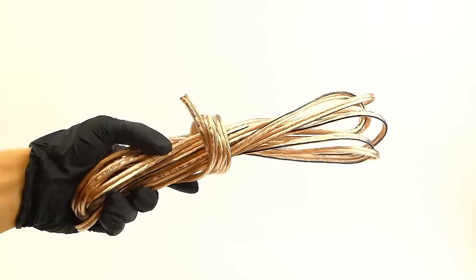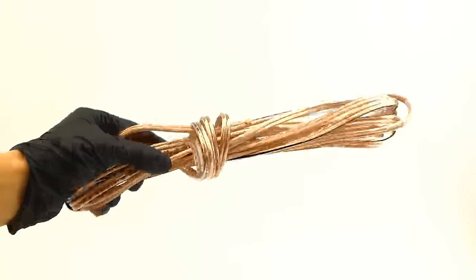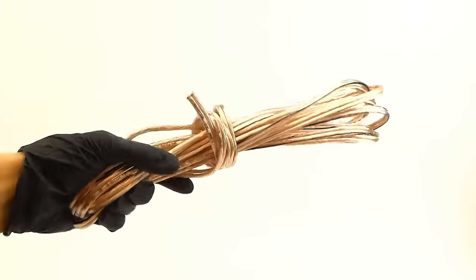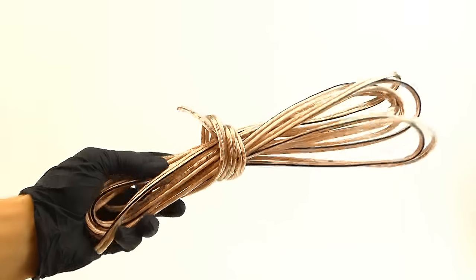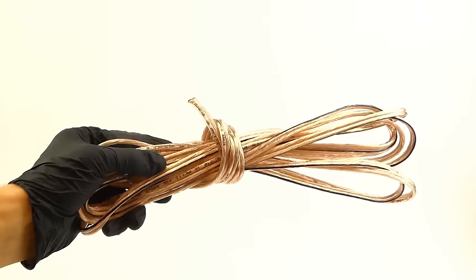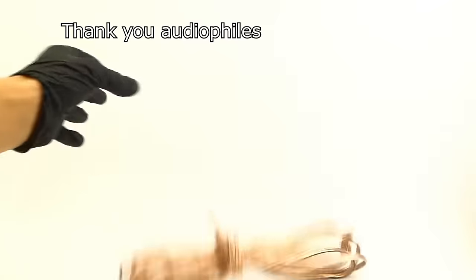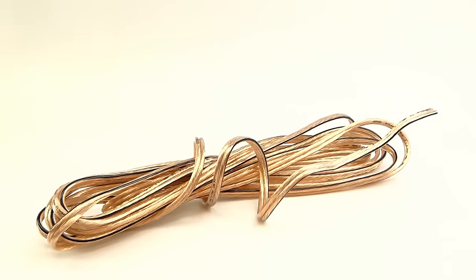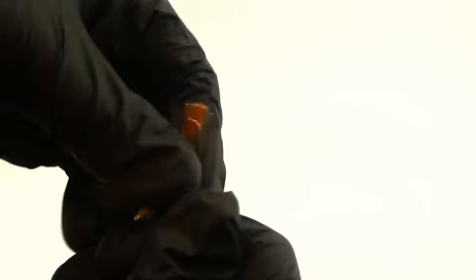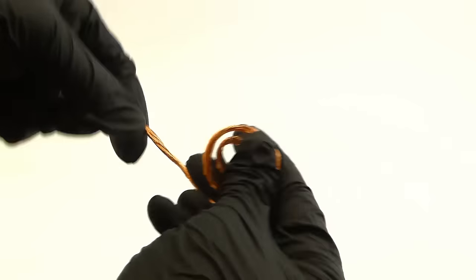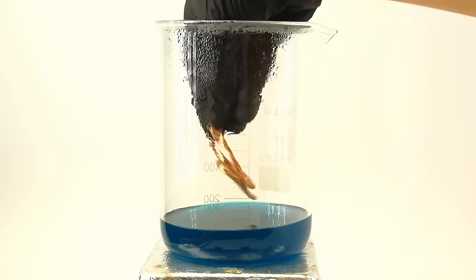For that, I didn't want to use dirty low-grade copper, which would contaminate everything, so I brought this ultra pure copper speaker cable, which exists only because some people think that it enhances the quality of sound. While I am not really sure of that, it's great for chemists, because these cables are an accessible source of pretty much 100% pure copper. To get it out of the cable, I cut a piece of it and stripped off the plastic coating, which took forever. Now with the copper ready, I rolled it into a coil and added it to the silver solution.